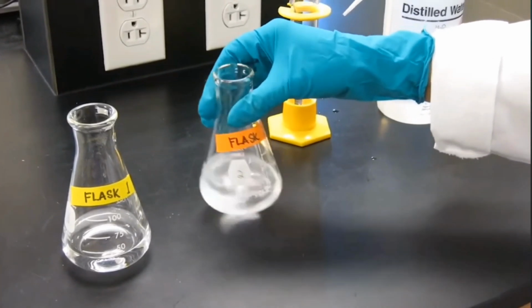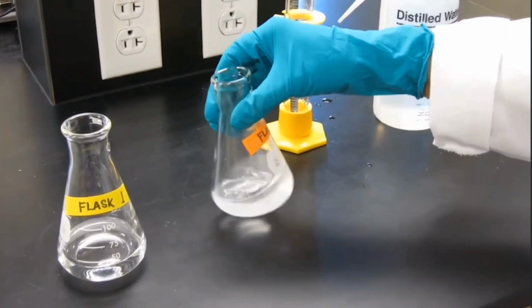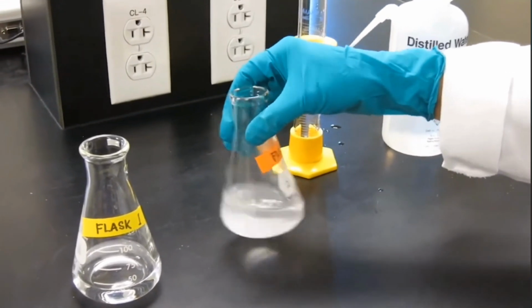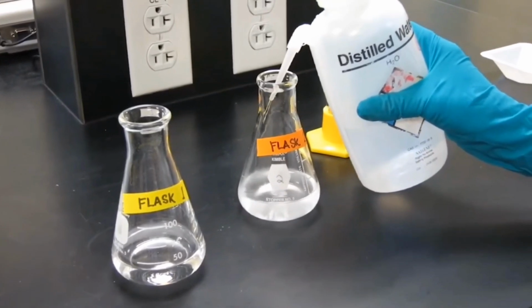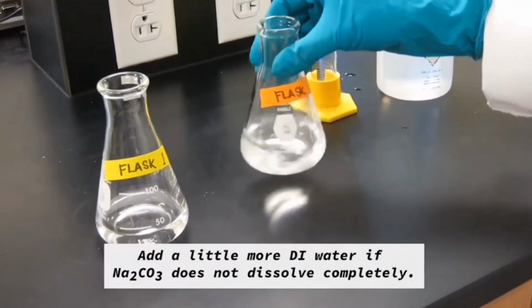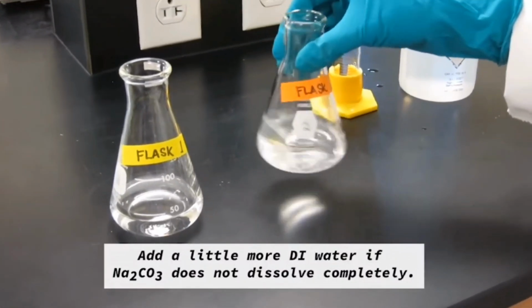After all the sodium carbonate solid dissolves in water, what are we going to do next? So make sure to dissolve it. Now you can see that the flask 2, which has sodium carbonate, is not completely dissolved. So you can add a couple more milliliters of water to get it to completely dissolve.